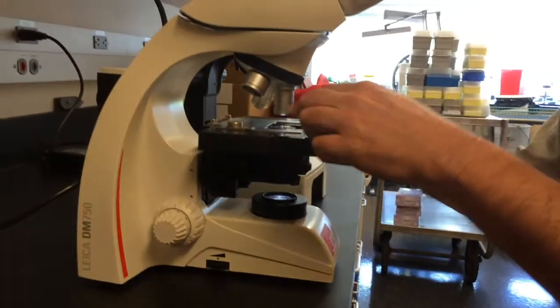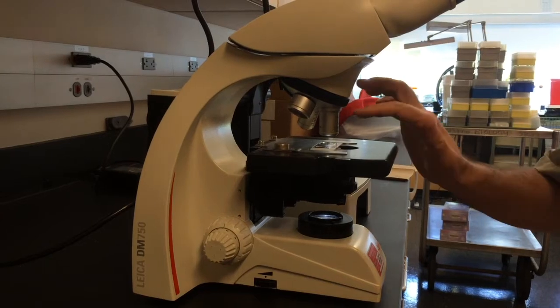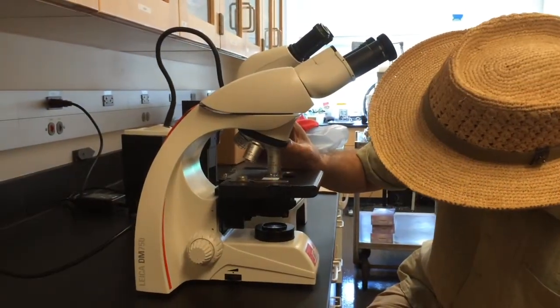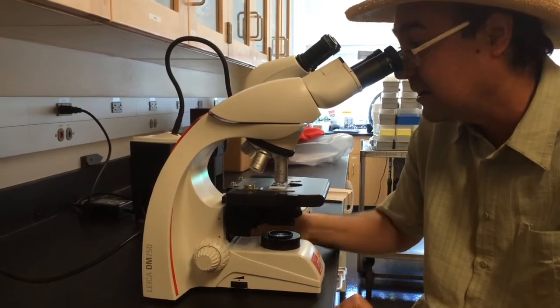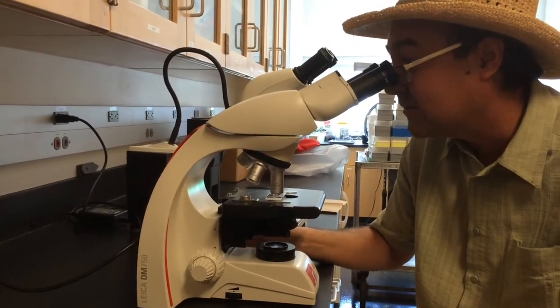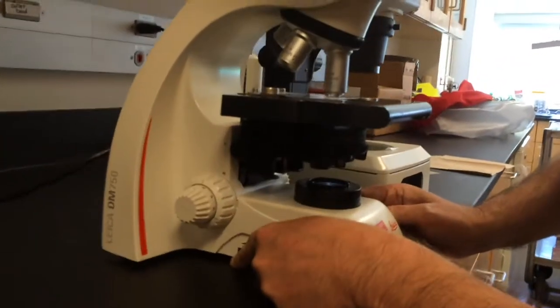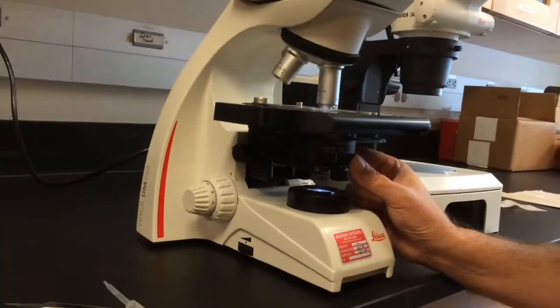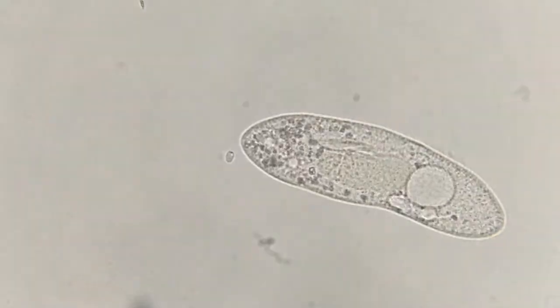And so now we're ready to put it on the microscope, and always do this using one of the short objectives. It should have been left with a short objective in place, not the long objectives. And that's still in focus. Great. And so then now I look through it, and I have to do just a fraction of a turn there. And then usually I have to adjust the light. So usually I have to increase the light on the dimmer there, and then change this thing to increase the light to just the right amount. Usually people have too much light.